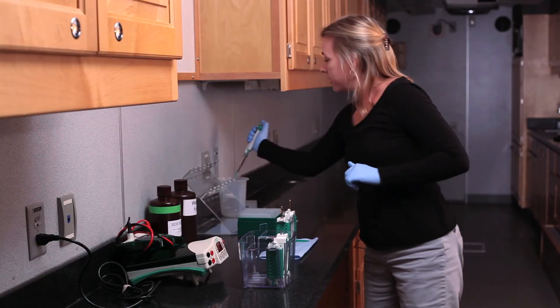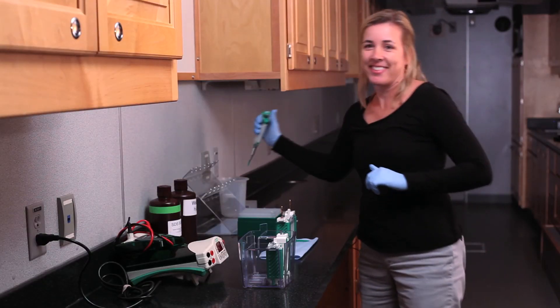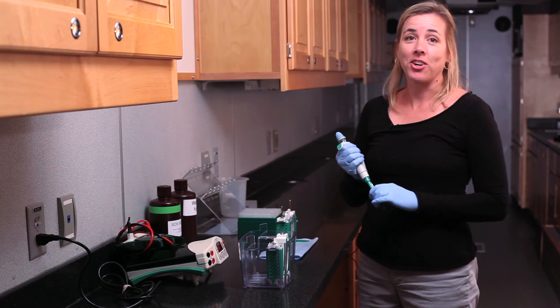And then I will eject my pipette tip. Now it's your turn to give this a try.